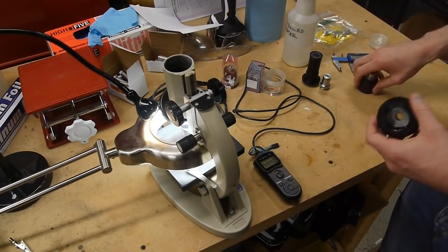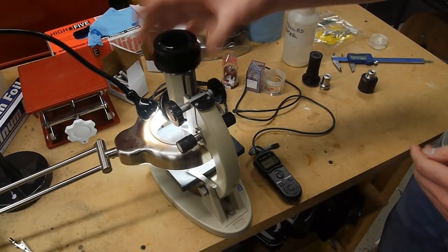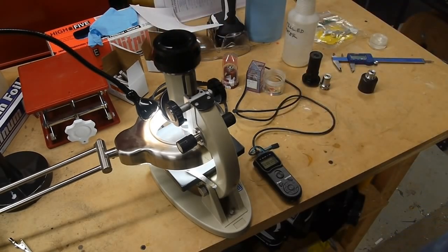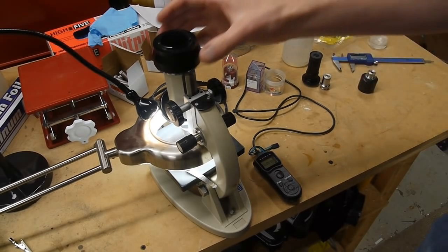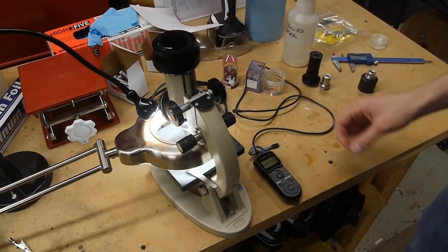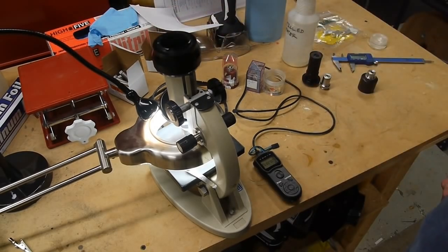So to use this, all I do is just simply place that on there, and the camera is attached here. I can't show it to you because I'm using this camera to shoot the video right now. And then you even have a slight amount of adjustment here to get the image centered and oriented just the way you like. One problem is that at really high magnification levels, the depth of field is quite narrow. So certainly you've seen pictures taken through a microscope where not very much is in focus, because that's how the optics sort of work out.